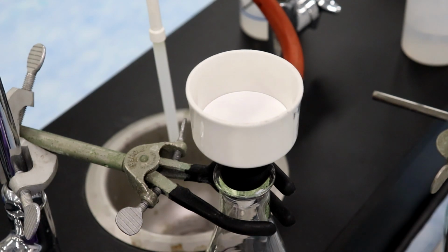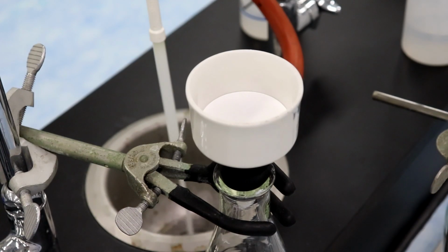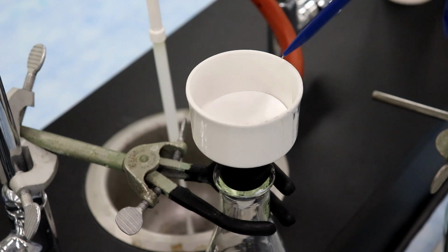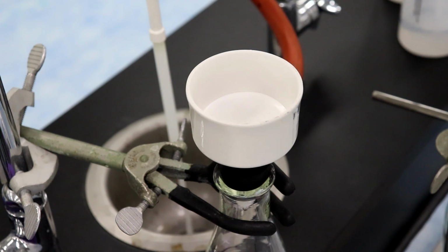All right, so turning on the water, which gives us our suction. You want to thin it out? I can add more water to that. No, we're fine. We're going to pre-wet this with some DI water. There we go. Let that drain out. Perfect. So the faster your water stream, the more suction it pulls.